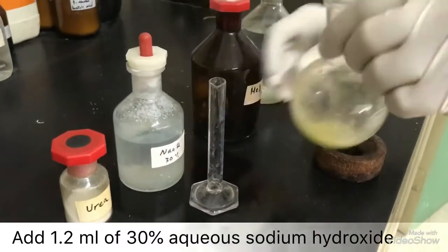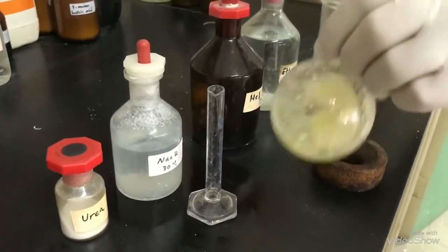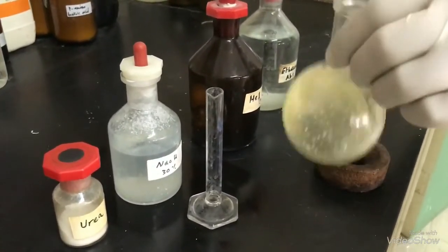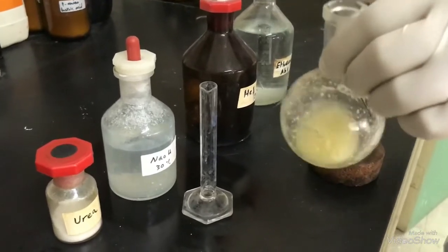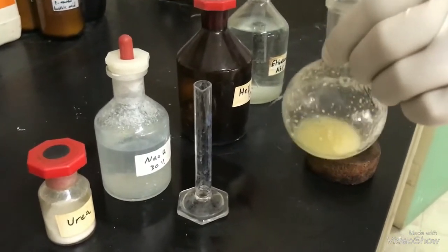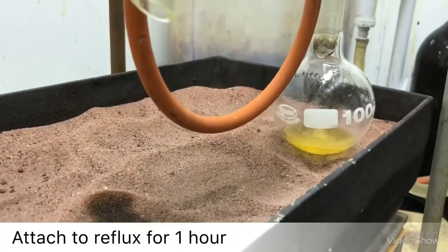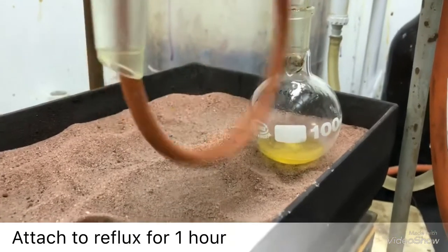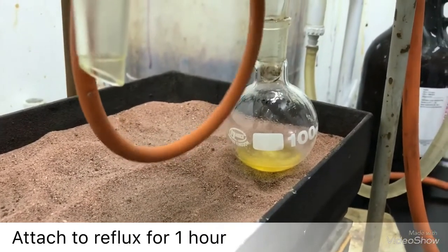Mix well. Then attach to the reflux condenser and boil for one hour. After one hour, take off your mixture.